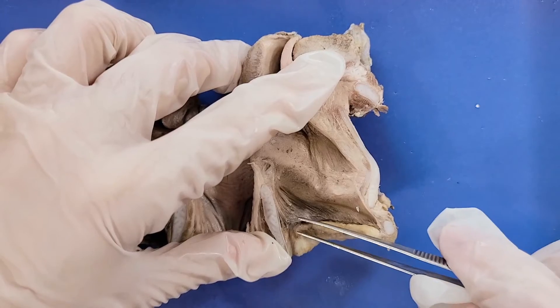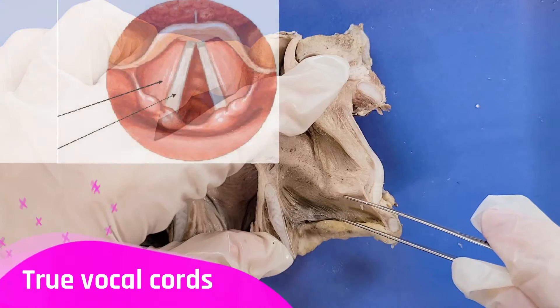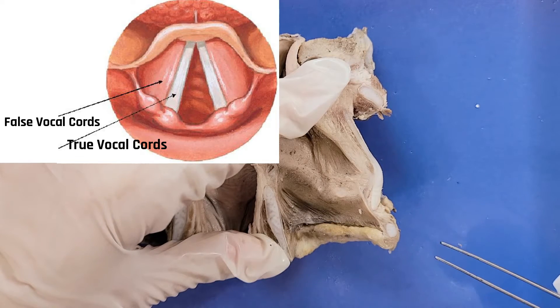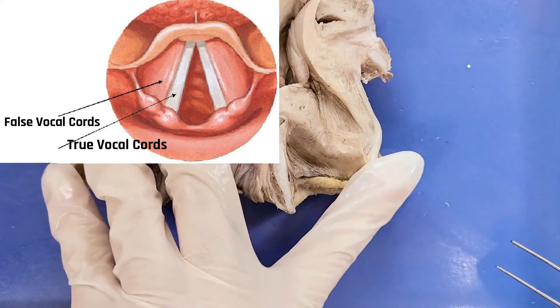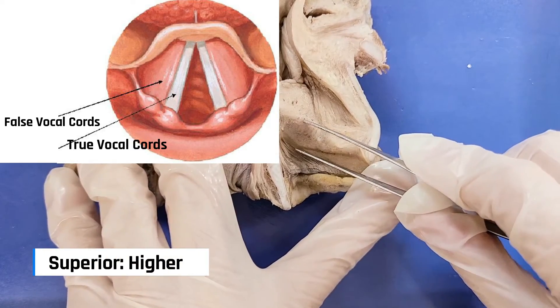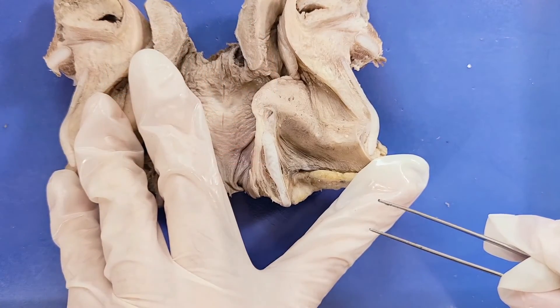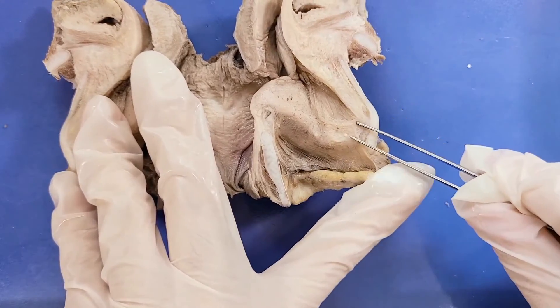You can see that there are actually two vocal cords. The inferior one is called the true vocal cords. The true vocal cords are more delicate and are the primary vocal cords involved in voice production and phonation. The ones that are more superior are called the false vocal cords. These don't play a role in voice production, but when vibrated, can create a deep, rough voice quality, screams, or growls.